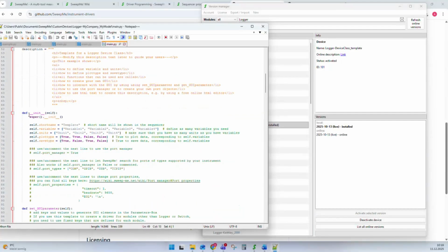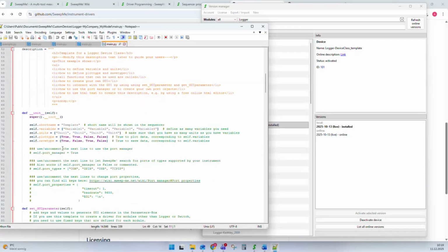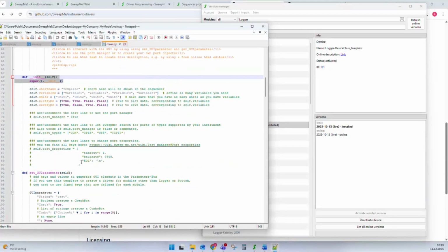The init function is a typical thing in Python that you initialize your class. And when we call super init, what you will find in every driver, it simply tells SweepMe or Python to also load and init the functions of our base class EmptyDevice. So once we did this, having this class, this init function, and the super init function, we are actually already having a working construction of a driver. Everything else is then something that you can add to modify the driver and add further features.